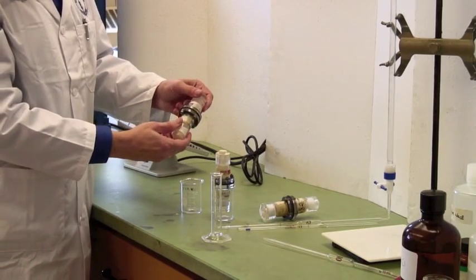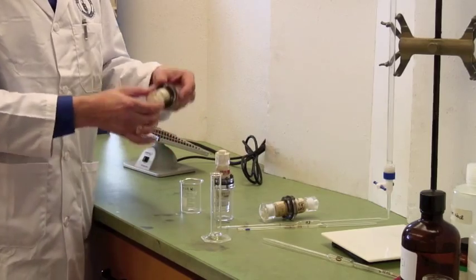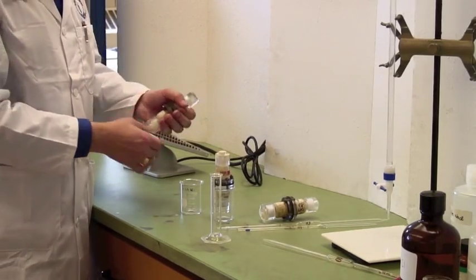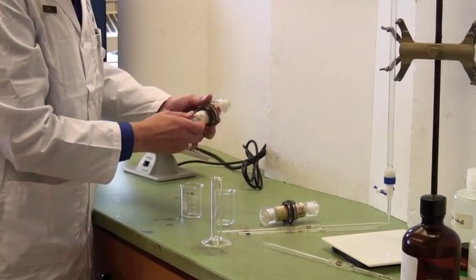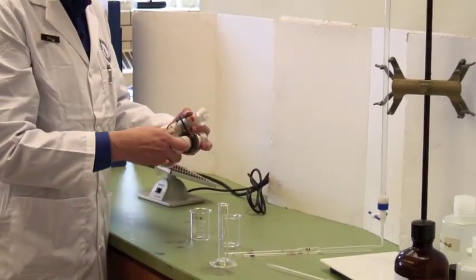Once they're tight, you don't need to mangle it. Once they're ready to go, then you put them in the agitator. We've got three cells here, and you can actually have more than one going at a time.